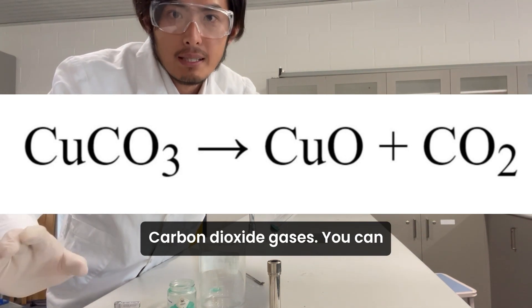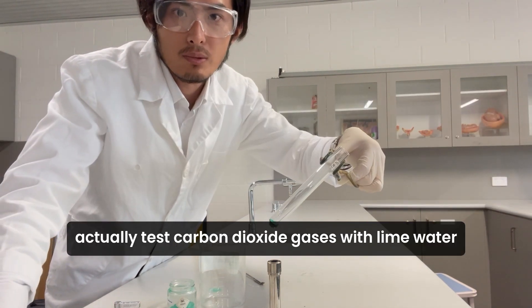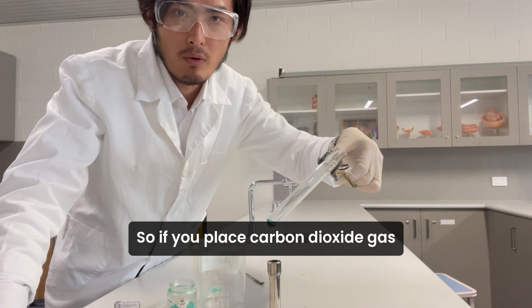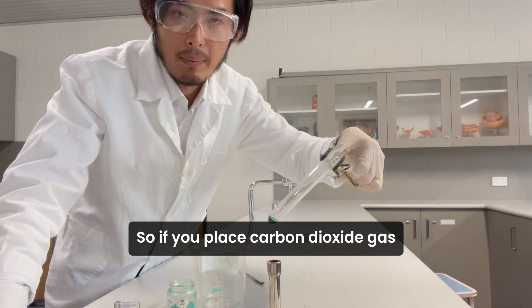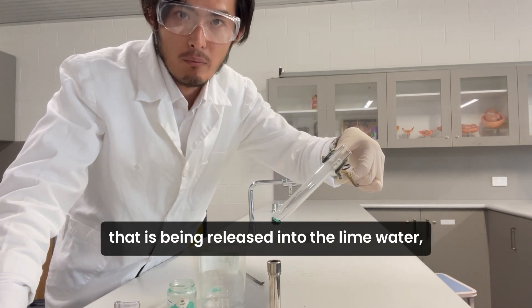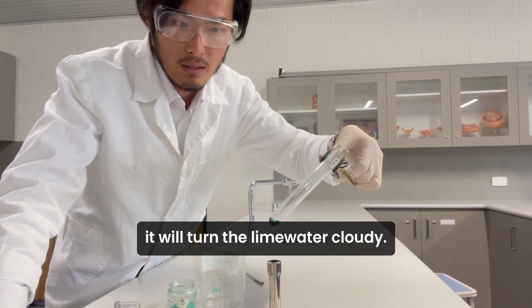You can actually test for carbon dioxide gas with lime water. If you place the released carbon dioxide gas into lime water, it will turn the lime water cloudy.